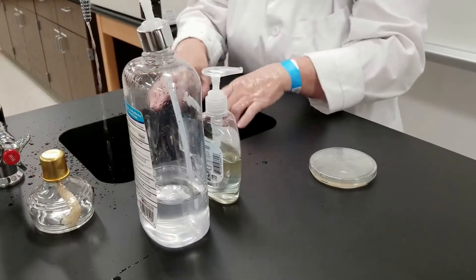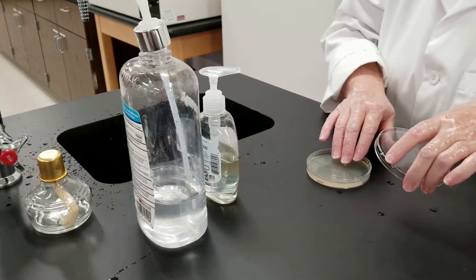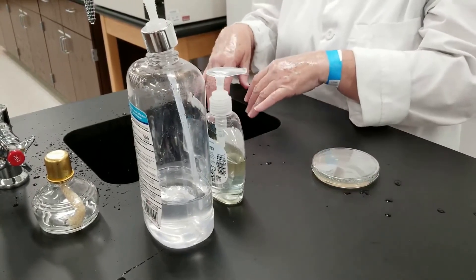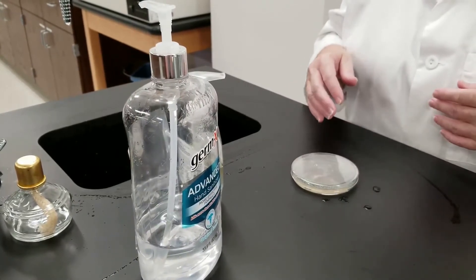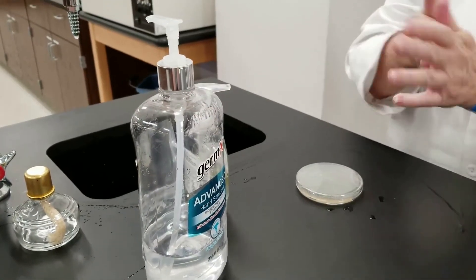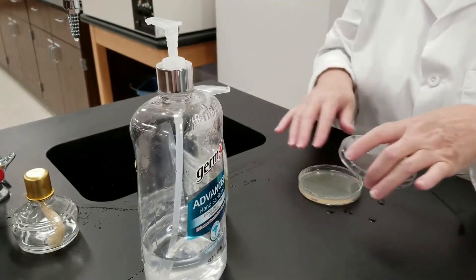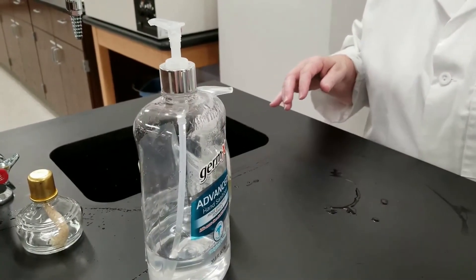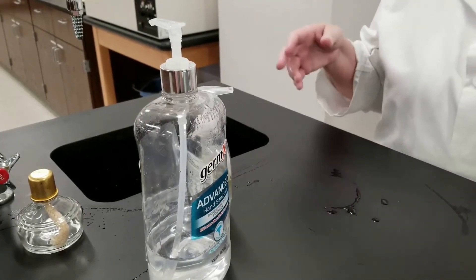Once I'm done, I'm going to use the same fingers that I used previously and touch down here. Now I need to dry my hands. For the fourth section on the second plate, I'm going to use some hand sanitizer — rub that on there and then touch. We'll incubate these and look at them tomorrow to see how effective the soap versus the hand sanitizer versus just rinsing with water versus doing nothing at all.